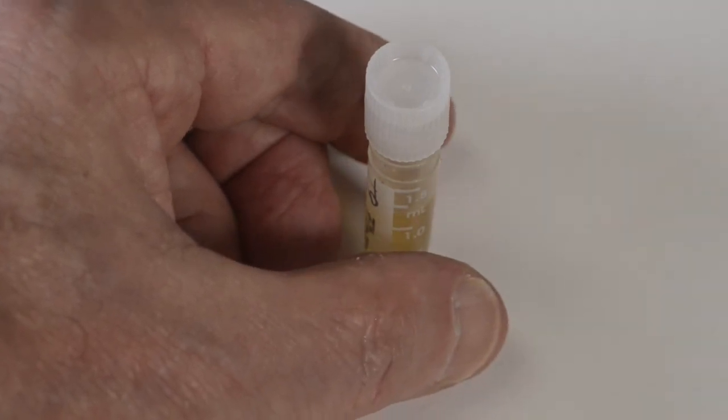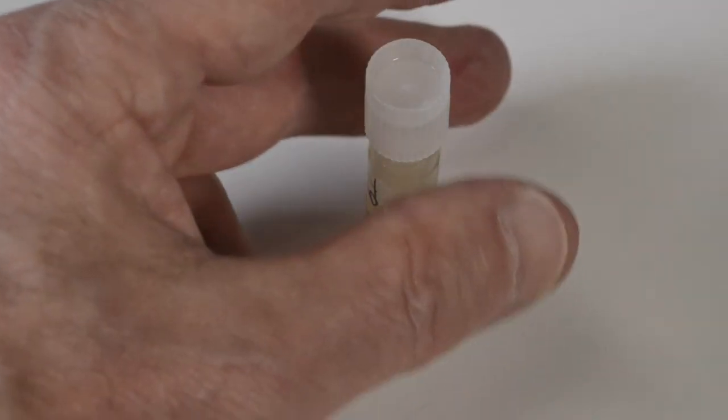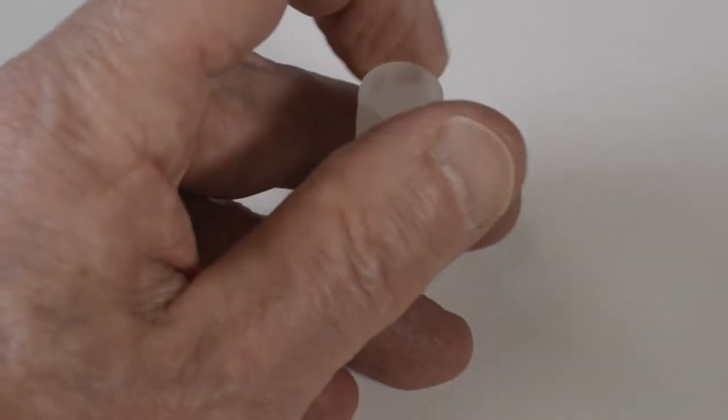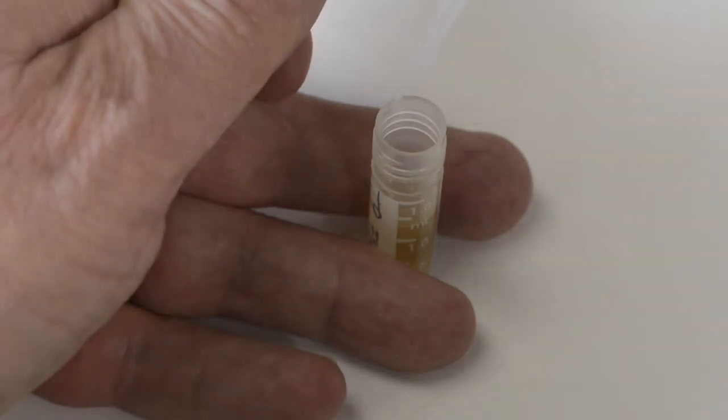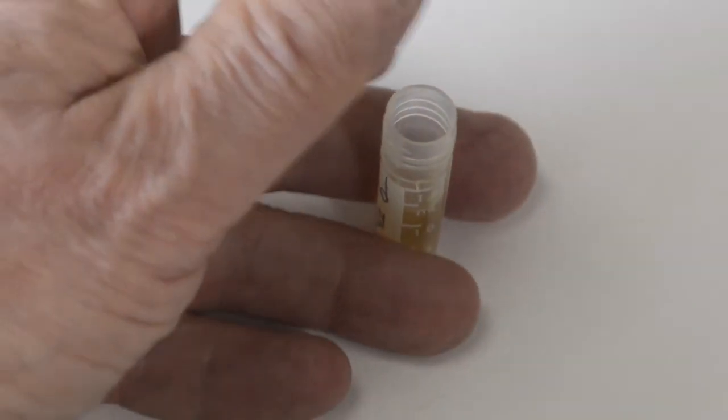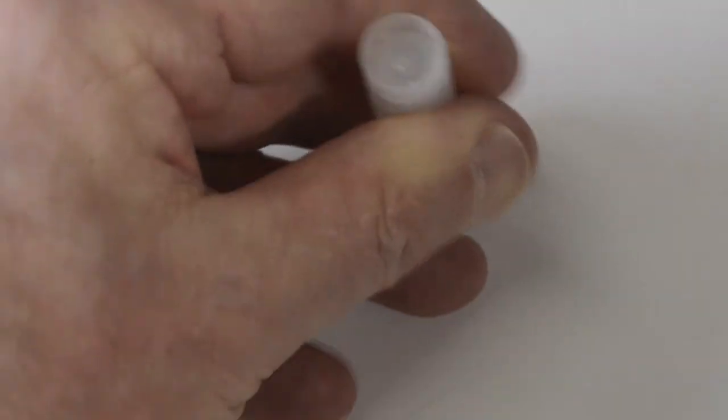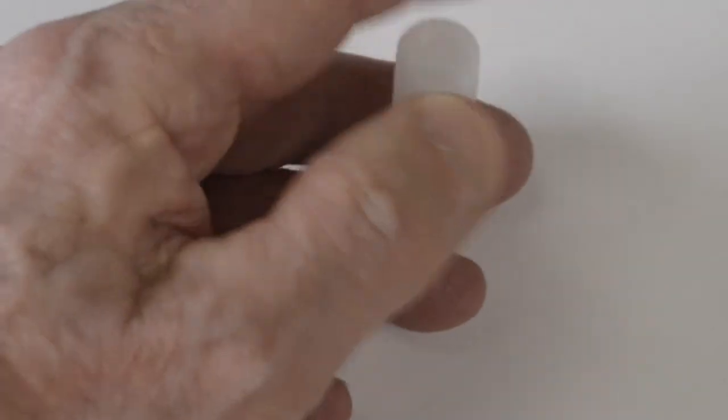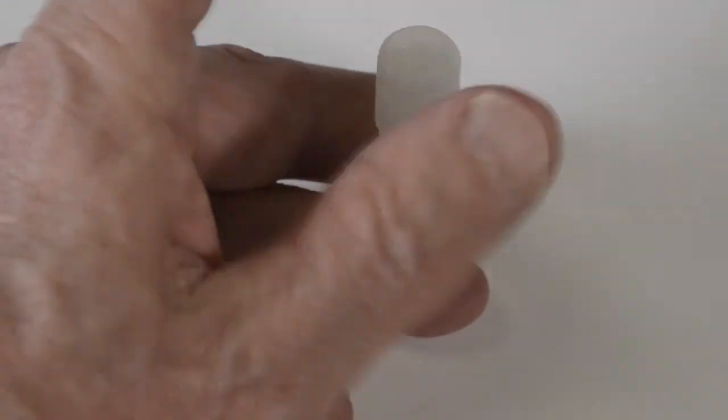And then again, once you gently touch a pipette tip to a colony, you're going to go immediately into this agar, as I'm showing here. Just plunge into it once or twice. Close the tube, and you're done with the stab culture. But don't set down your pipetter.